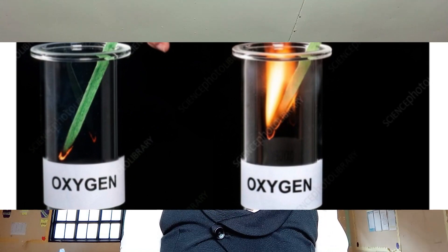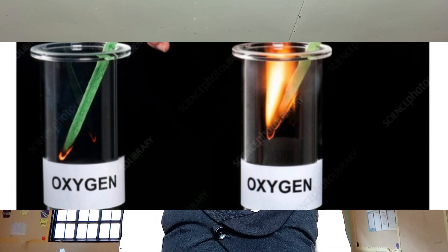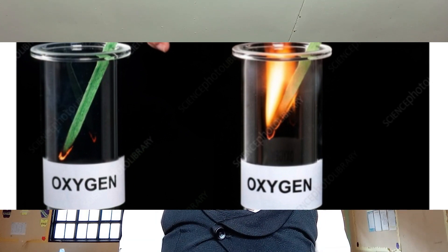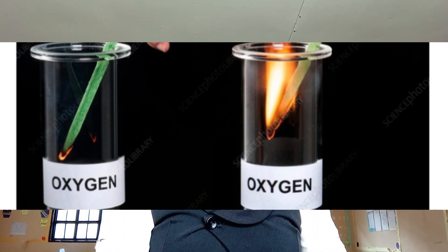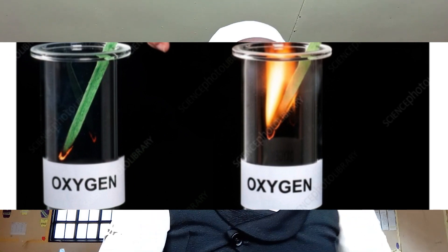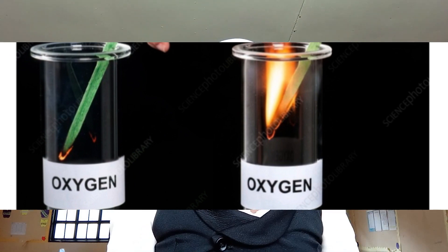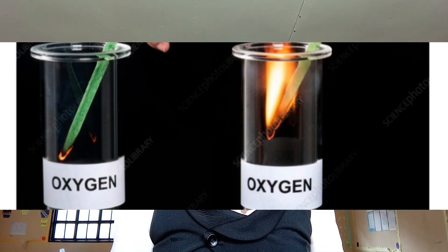So when you have a glowing splint and put it in a jar that contains oxygen gas, the gas is likely to relight that glowing splint and it will produce fire.